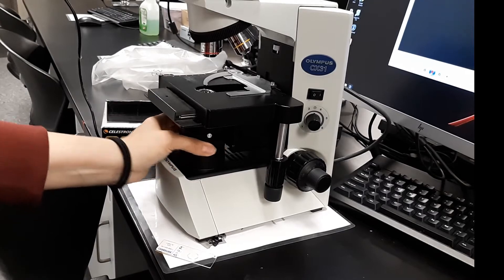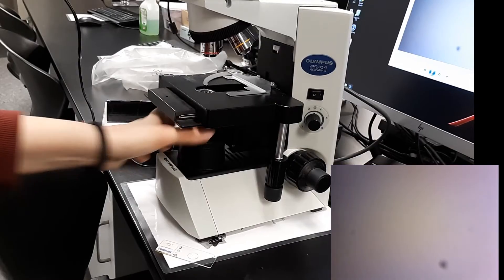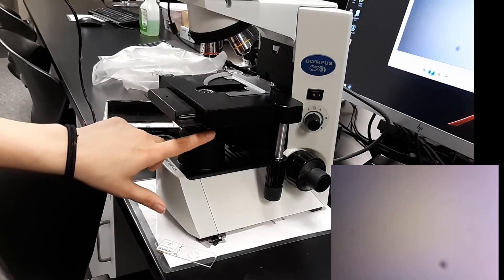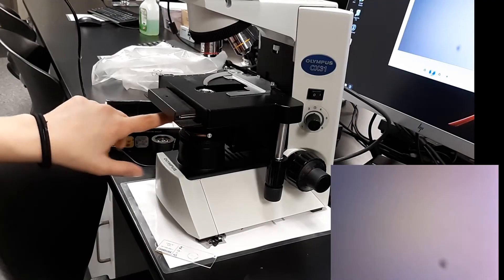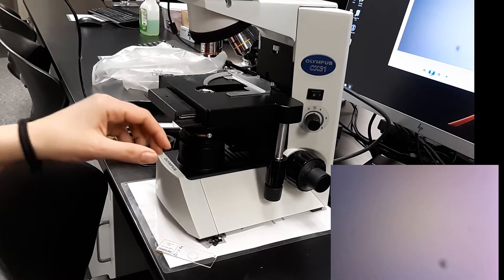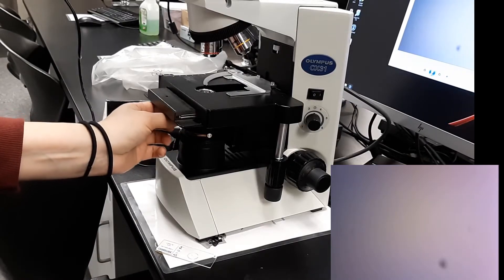We're going to rotate this black ring to the left. And then we're going to rotate this black little lever, not the metal screw pin, but the black lever to the left. That's the iris diaphragm lever. That allows a certain amount of light to go in depending on how much you have it closed.